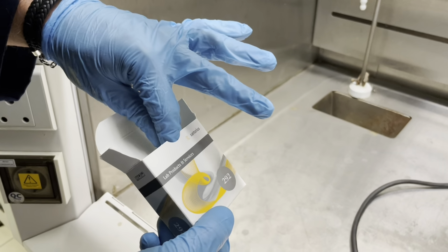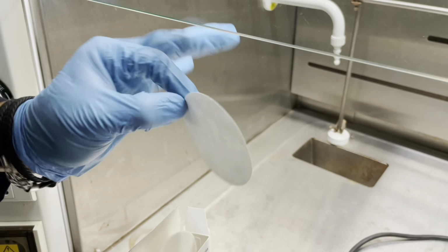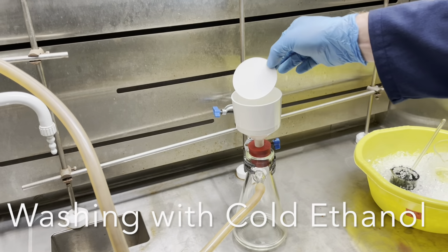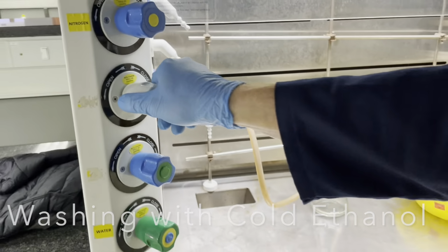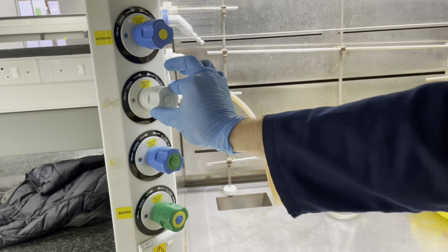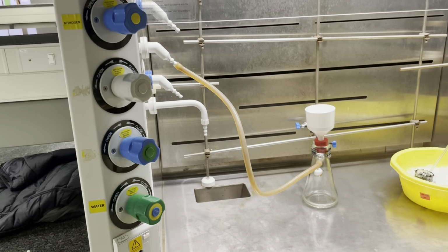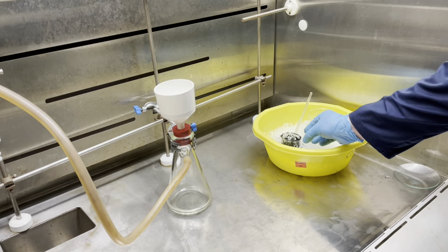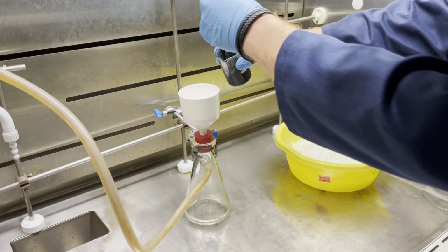Next, collect a filter paper of the appropriate size from your demonstrator or the lab manager. Place the filter paper at the top of the Buchner funnel and now switch on the vacuum by turning the knob that indicates vacuum to the left-hand side. Just follow the arrows. Now you will take your reaction mixture and slightly swirl it before pouring it into the Buchner funnel.